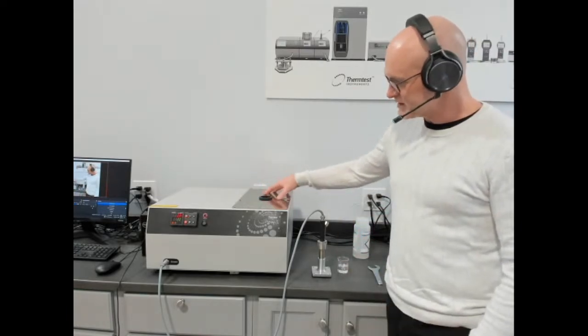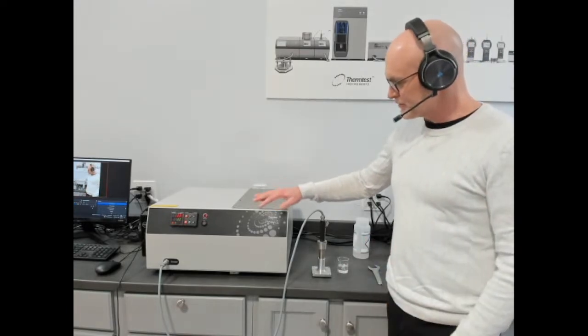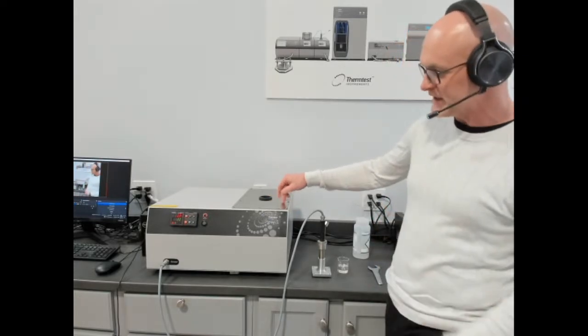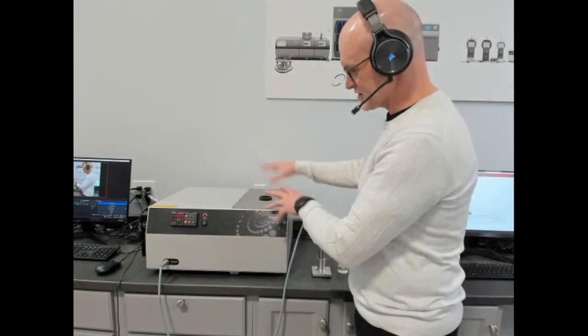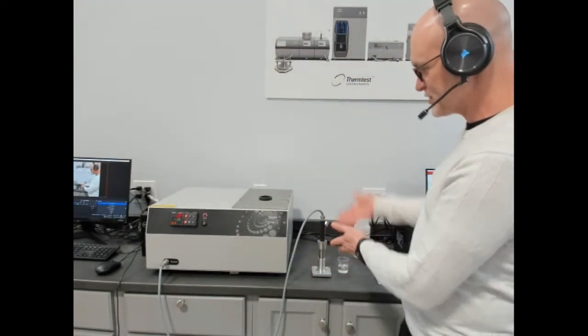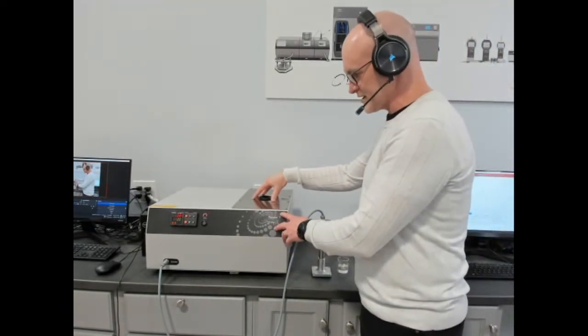So this unit, as well as our MP1 series, has a proprietary heating and cooling device which allows us to integrate heat along with the controller. So inside this one box is both the data acquisition as well as heating and controlling temperature. Now, of course, you can make measurements at room temperature, but you can also make measurements over a temperature range.